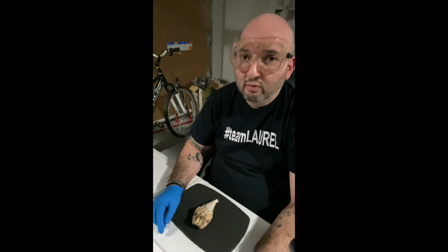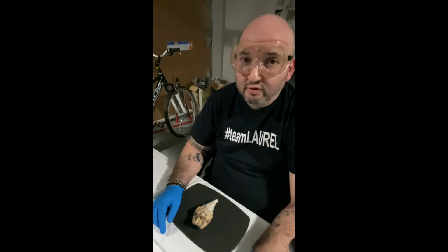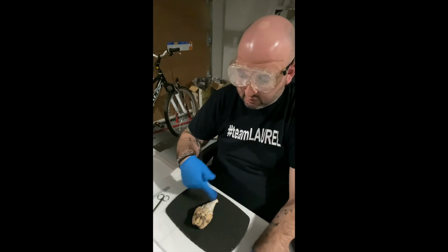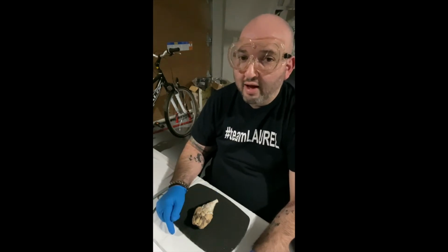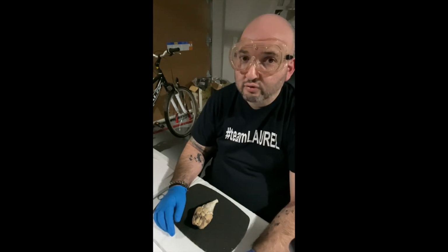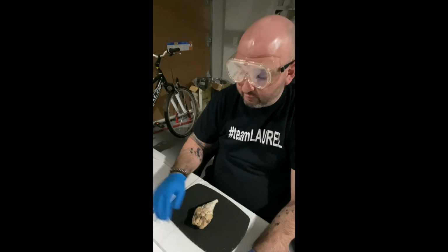In this week's video, I'll be talking about the gross anatomy of the central nervous system, and its anatomy, of course, and its physiology, what it does. In order to demonstrate that, I'll be dissecting the sheep's brain, which is located here. I'll be going through the anatomy of it, of course, and then what each part does in relation to what it does in the human central nervous system. So with that being said, I will go ahead and get started with the dissection.